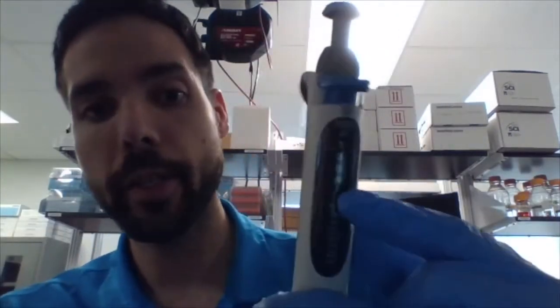I should not go above that 1,000. I'm moving this to adjust the volume. But that's as high as I can go. If I want to bring that volume down, so it's like a smaller volume, say 980. And I just turn it as needed to get to 980.